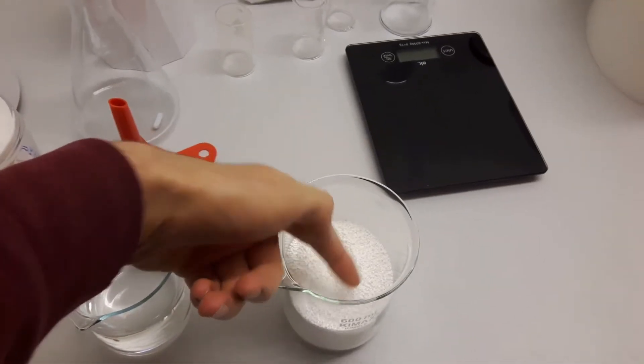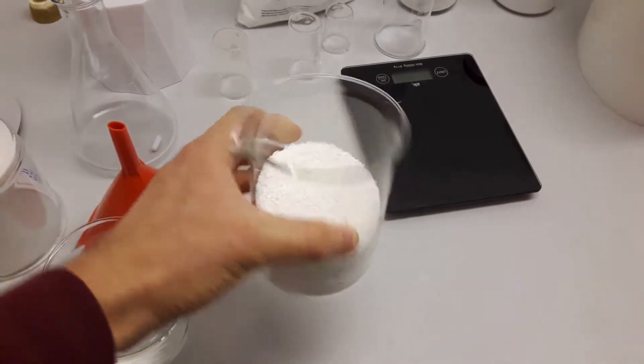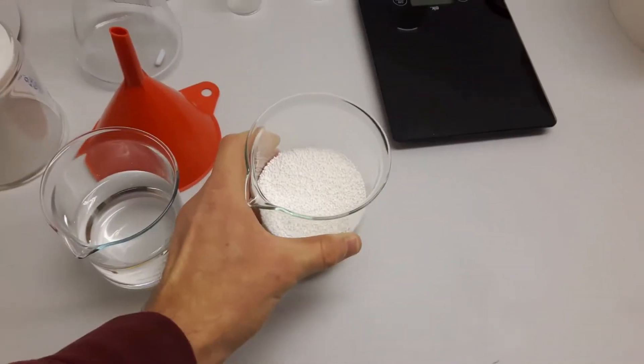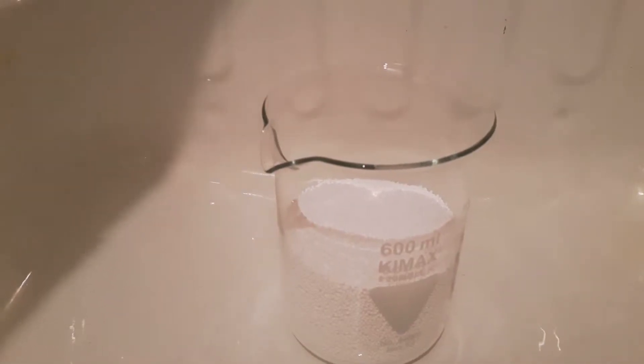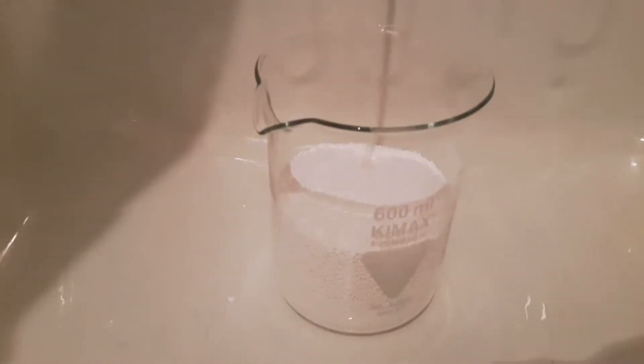Probably not the most special reaction you've ever seen, but it was a precursor for another video. Here you have the sodium benzoate. I just got it from eBay as a food additive.